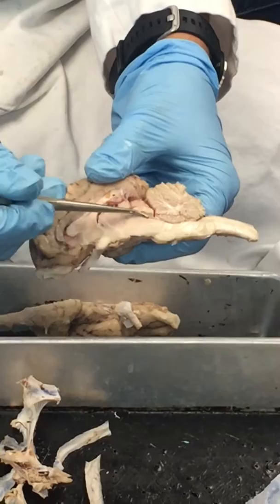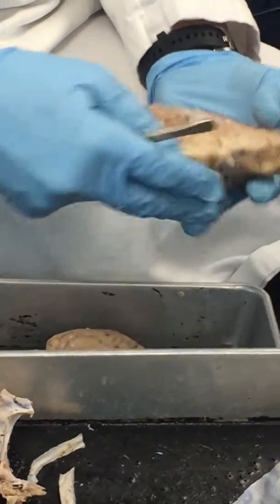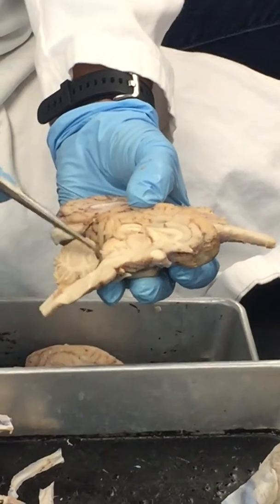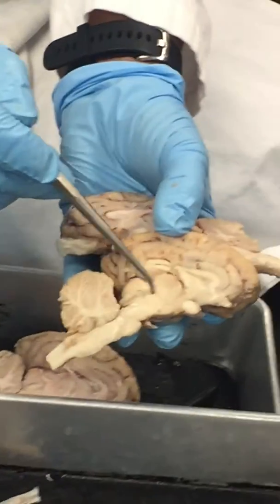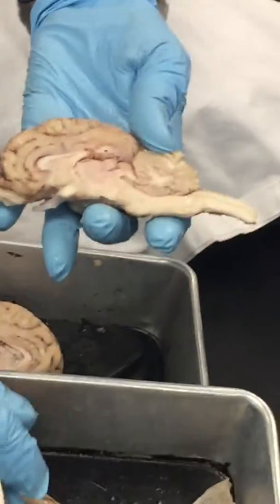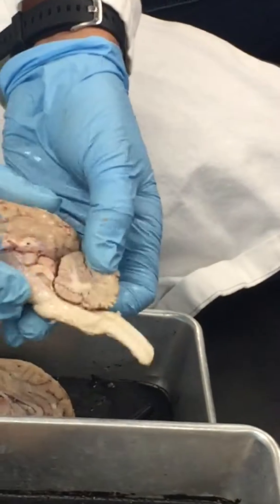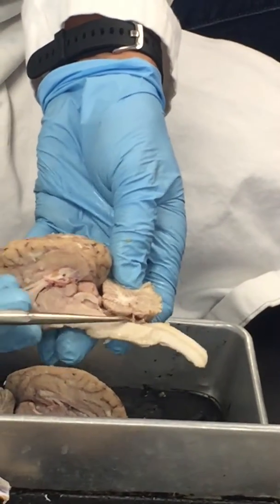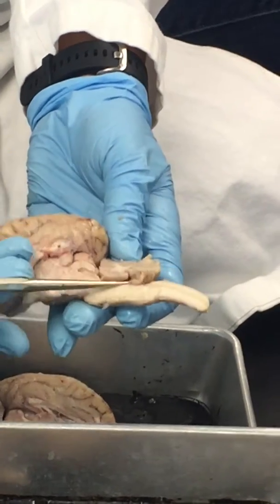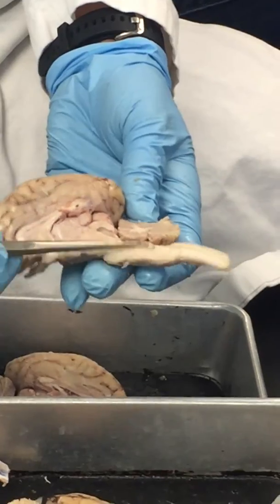That third ventricle leads down into the cerebral aqueduct, which, you know, you got to look at all sorts of different models or sections. You can see that running this way, right? That cerebral aqueduct a little bit there. It's going to come down here into our fourth ventricle. The fourth ventricle is between the pons and the cerebellum, right? This space right in here. Again, more choroid plexus inside there, if I don't tear apart the cerebellum. Got a little bit of it there.